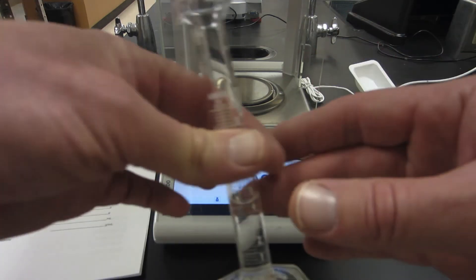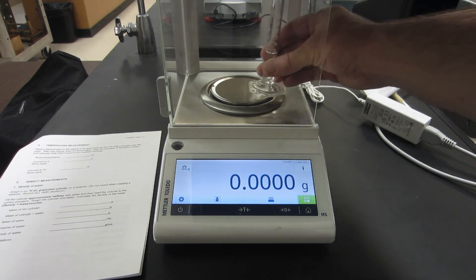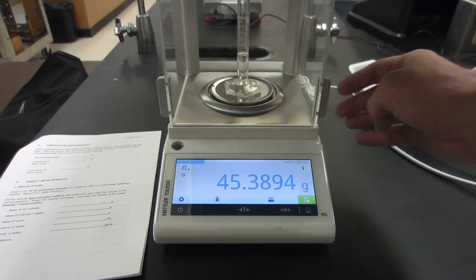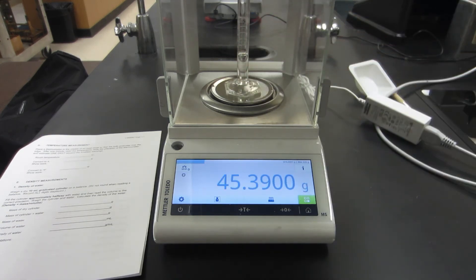Now here comes the graduated cylinder with water in it. We'll see the volume at the end of the video. Wait for it... there we go.